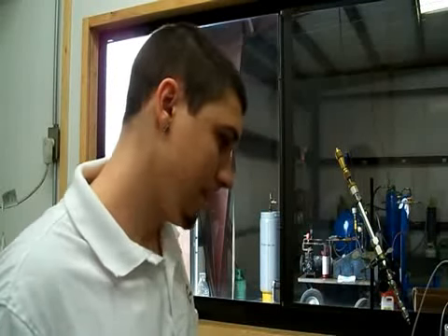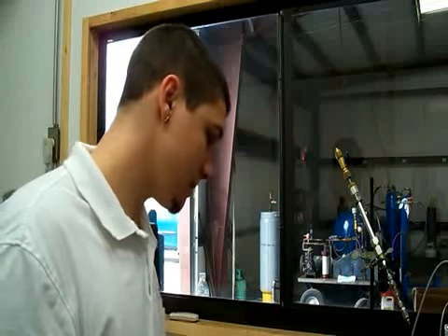I see. So as far as the refrigerant certification, that's a very important word here. In fact, it's part of the company's name. Yeah, one of the big certifications. Tell me, how do we get that certification? Some people don't realize that it's mandated by the EPA that no refrigerant, no gas, can change ownership without first being certified. So how do you get that certification?